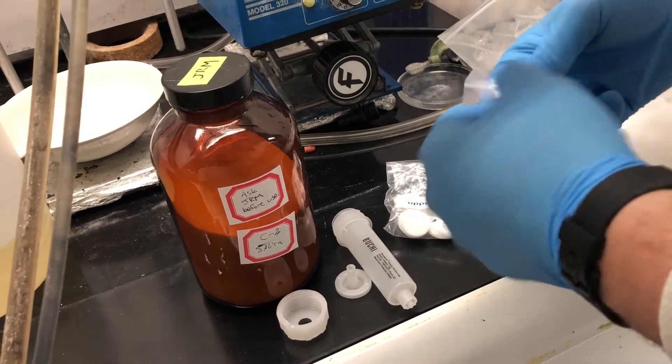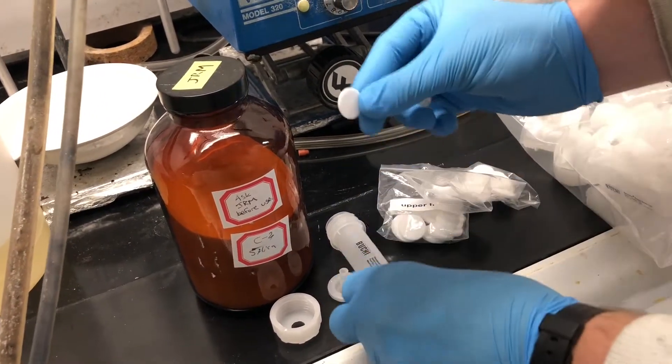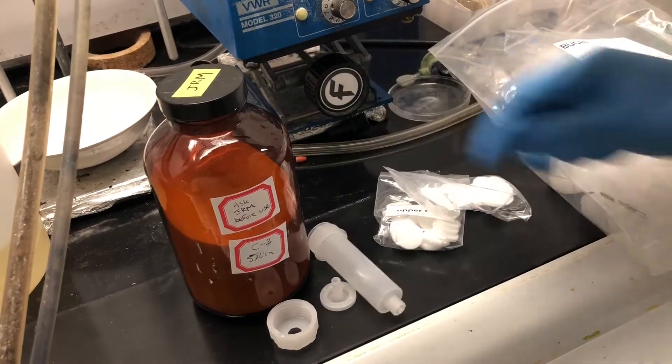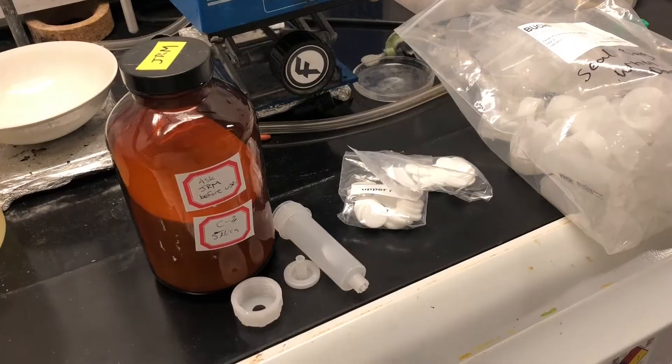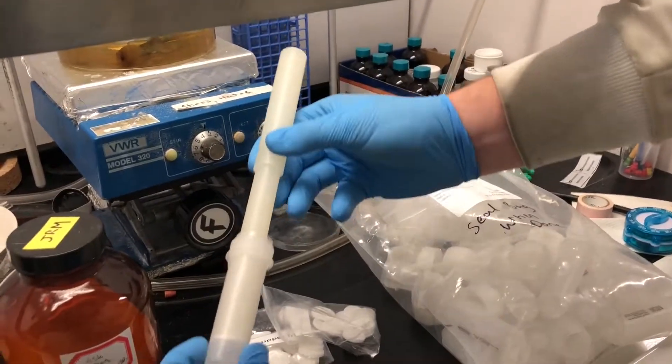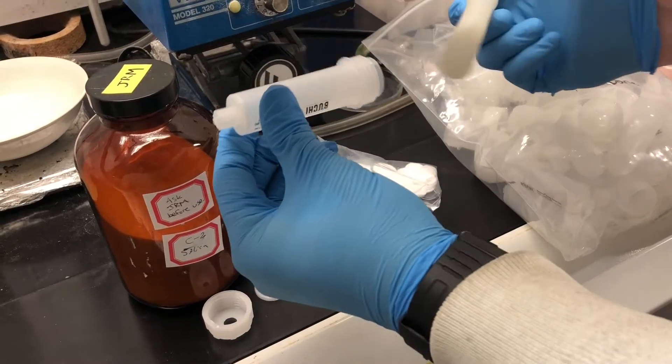We're first going to take this lower frit and insert it in. You're going to take this insertion rod and push down the lower frit.